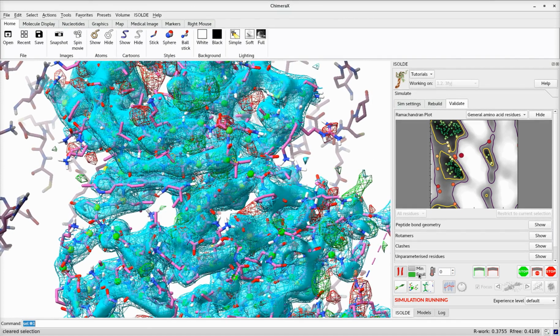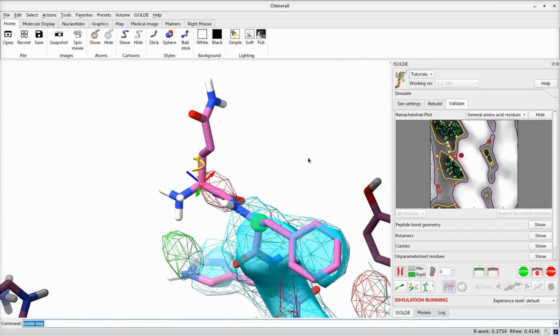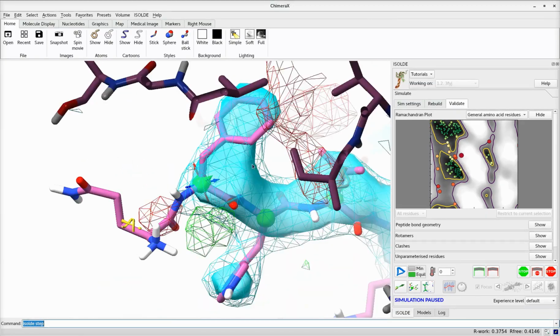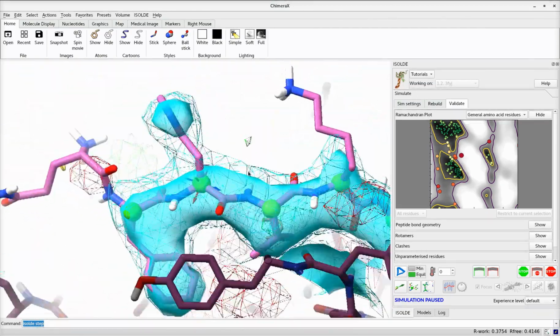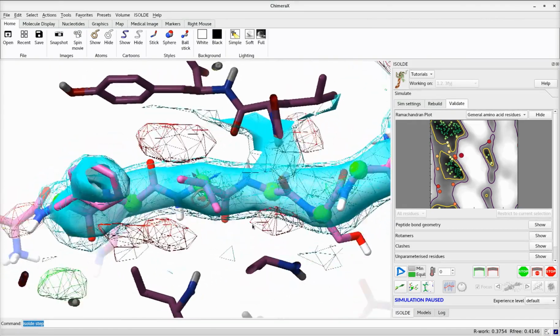While the Ramachandran plot has drastically improved and the fit to data is also looking better, it is very important to remember that restraints like this should be used as an aid rather than a replacement for manual rebuilding. At this stage, the model still contains correctable errors.